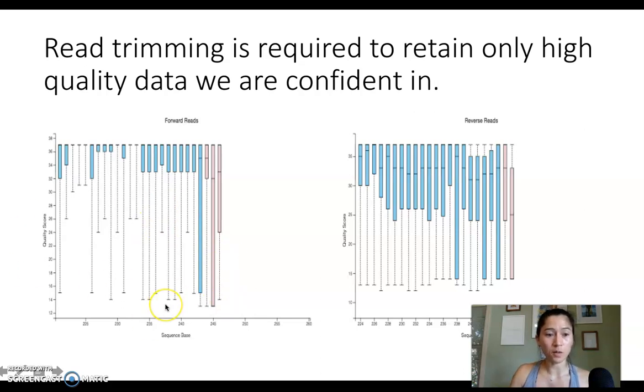This is an example from our actual data set that we are working with, garter snakes. This is for the forward read. If we look here, this is where we start to see a drop off in quality. Here, the bottom of the box part of the box plot, or the first quartile, is all the way down at about a 15 quality score. So I would say to use this base pair here, 242, as the last good one we want to use. That bottom of the box is well above that 20 score that we're considering minimally acceptable.